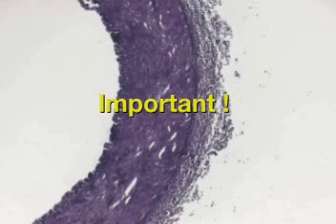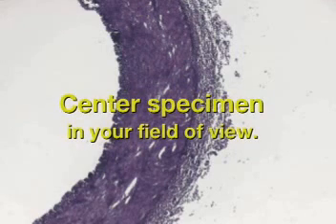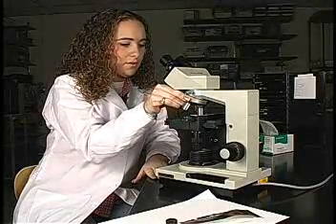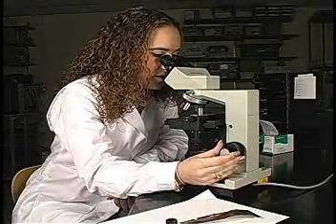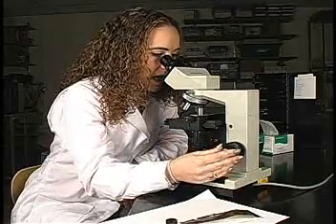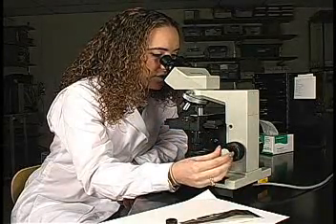What you see here is the cross-section of the human artery. The empty center is where the blood would flow. The pink section is the smooth muscle and the purple strands are elastin. These are the effects of using the coarse focus, fine focus, and XY controls. There is one important thing you must do before going to the next objective: place a desired part of the specimen in the center of your field of view. We can now move to the 10X objective. In order to see the specimen clearly, you may need to increase the light by opening the iris and using the fine focus to get a sharper image.